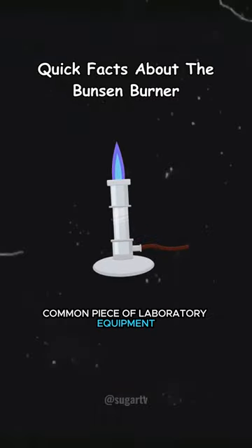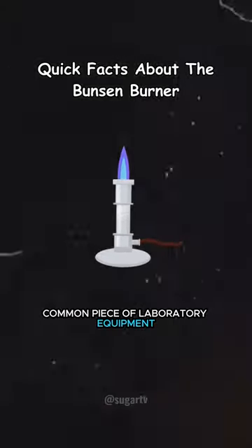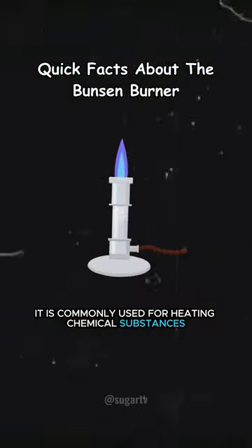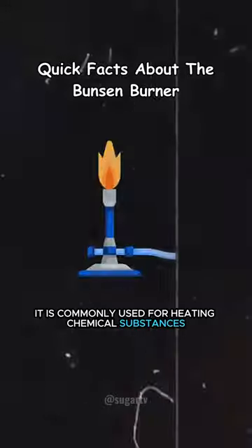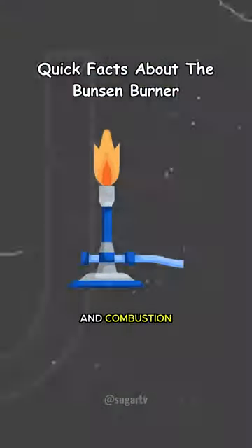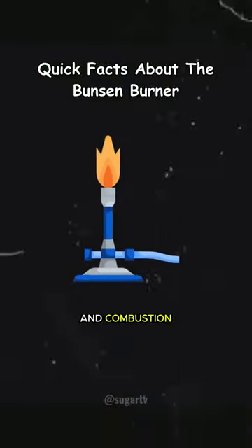A Bunsen burner is a common piece of laboratory equipment. It is commonly used for heating chemical substances, sterilization, and combustion.